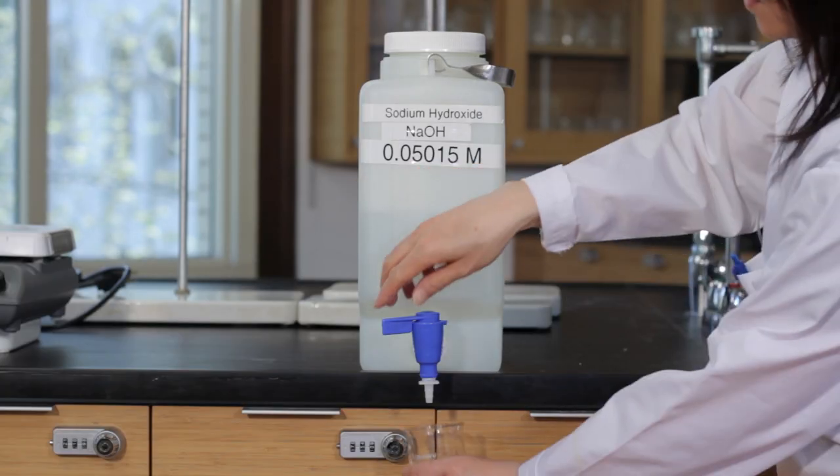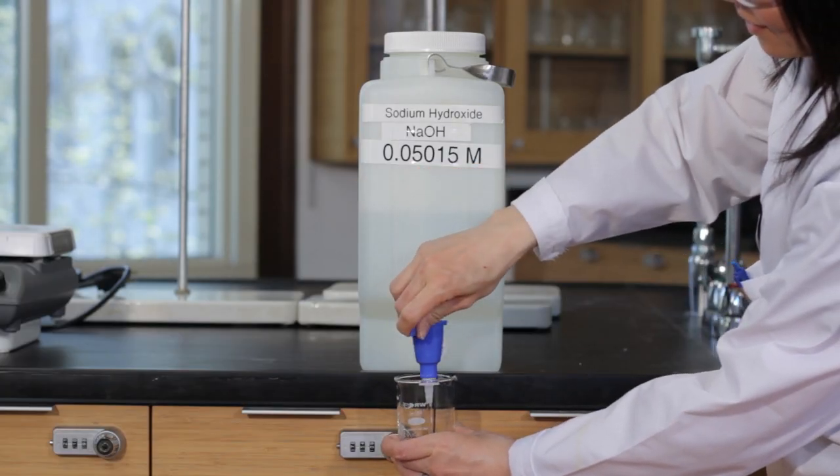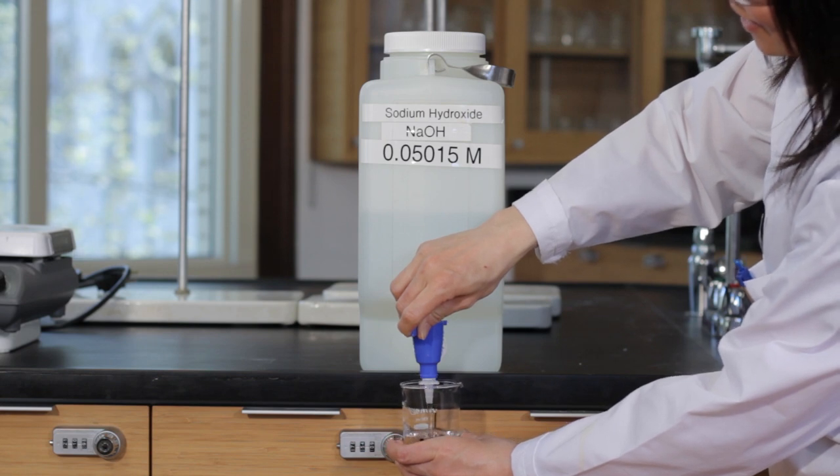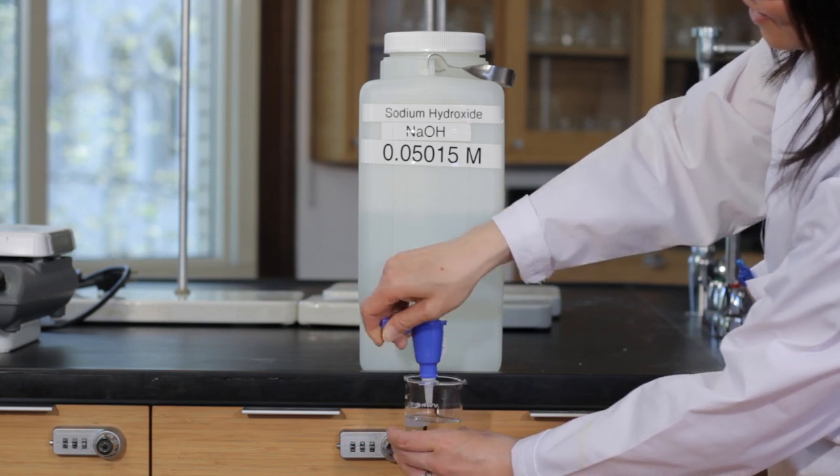Record the concentration of the standard sodium hydroxide solution. Transfer some of the sodium hydroxide from the main source into a clean, dry, medium-sized beaker.